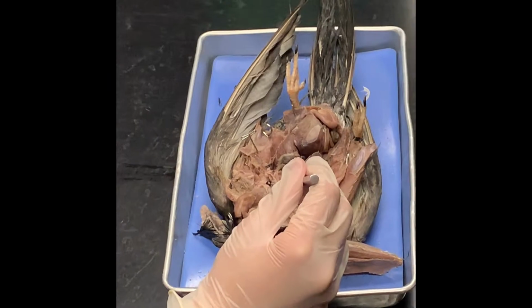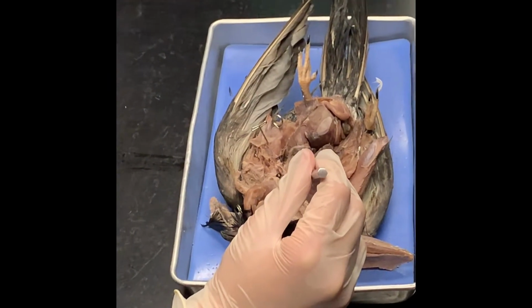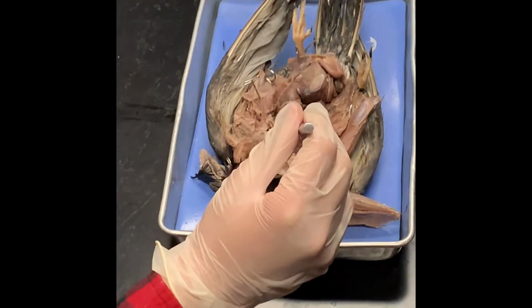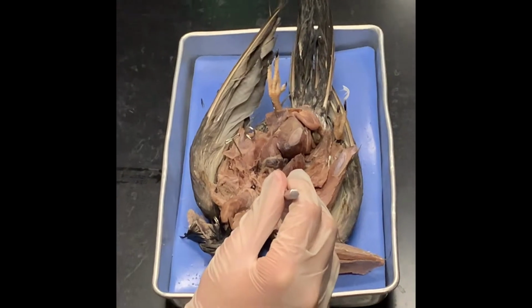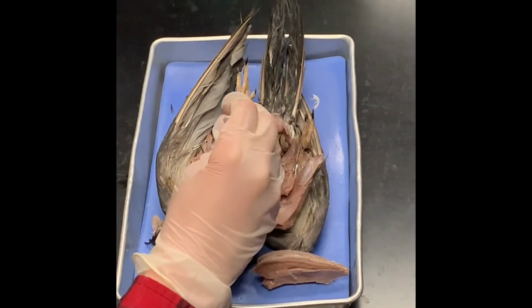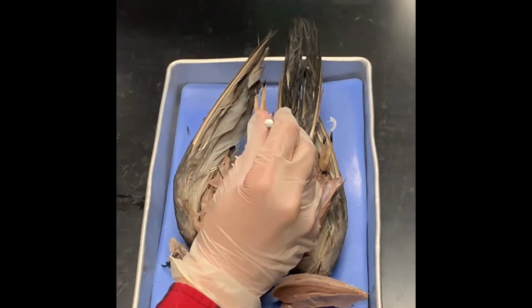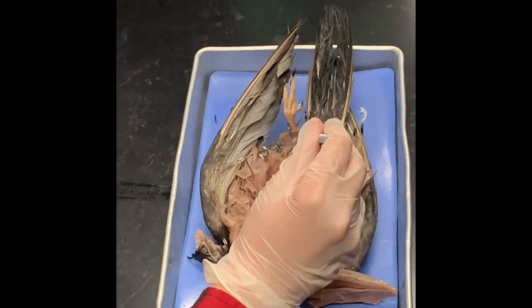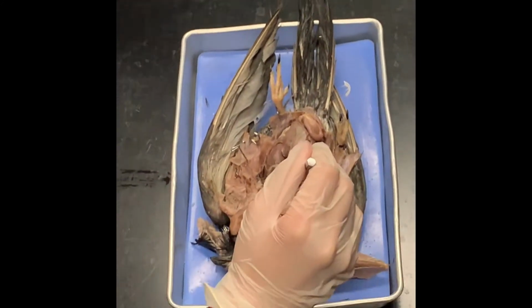Okay, but again, I know we can't really see the gizzard or the stomach, unfortunately, and the crop has been destroyed, but that's how it usually goes when you dissect and you have to remove the keel. But you can see what's after the stomach. It's the intestine, right? So what's the beginning of the intestine? The duodenum. And notice everybody what's wrapped up by the duodenum? The pancreas. Do you all see it there? I think it shows up quite nicely in our pigeons.